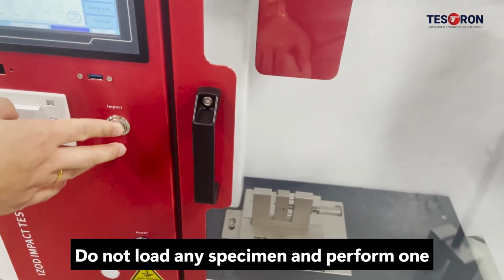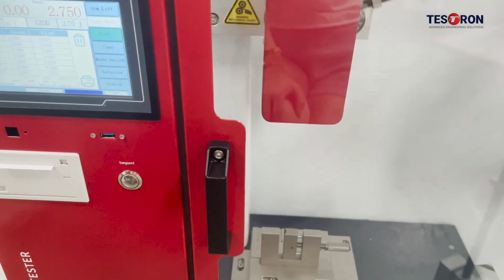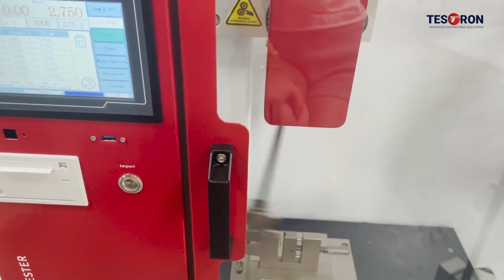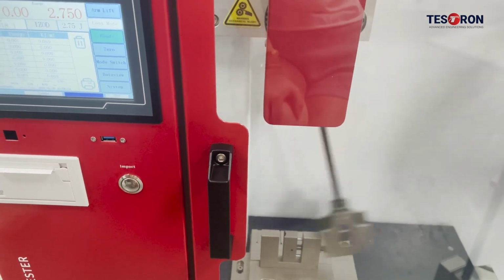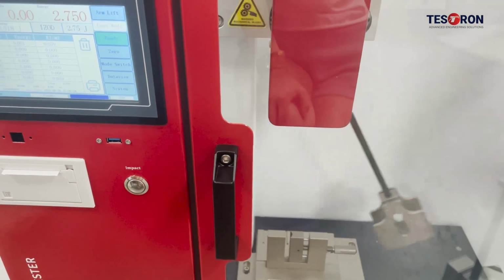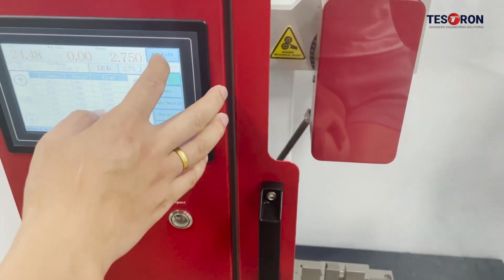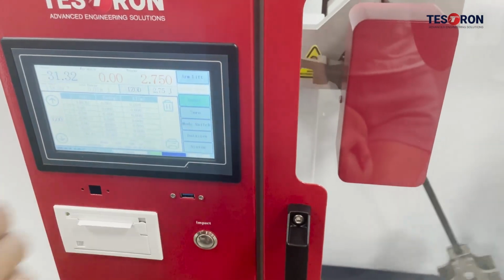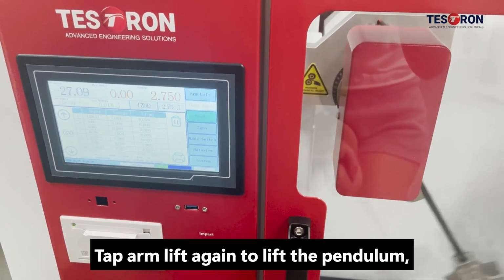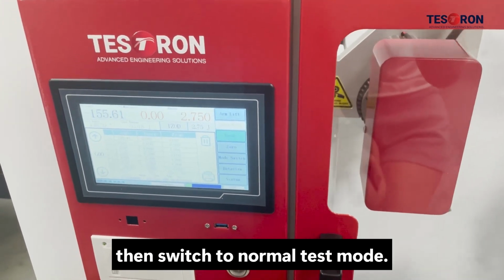Do not load any specimen and perform one blank impact cycle. Tap arm lift again to lift the pendulum, then switch to normal test mode.